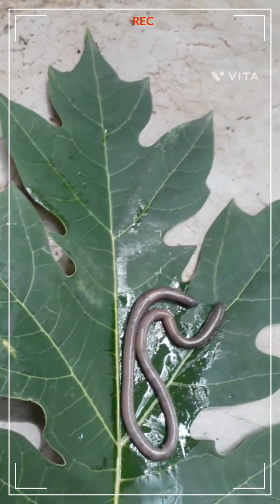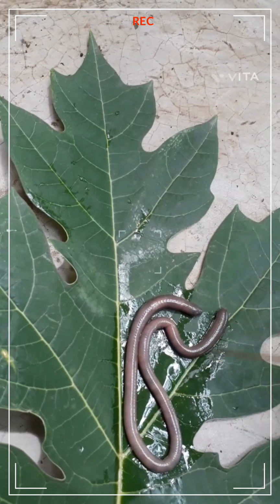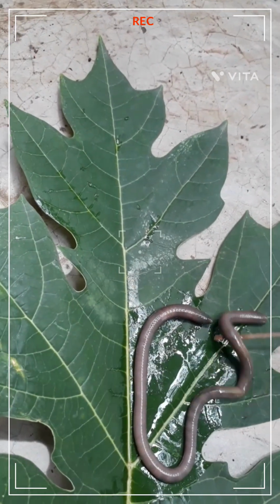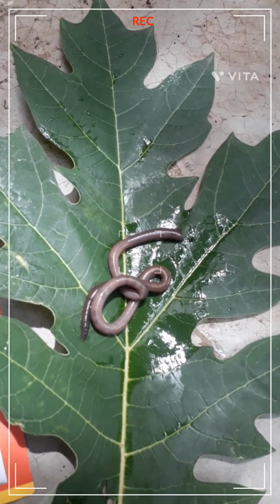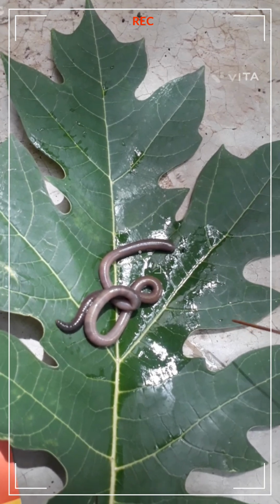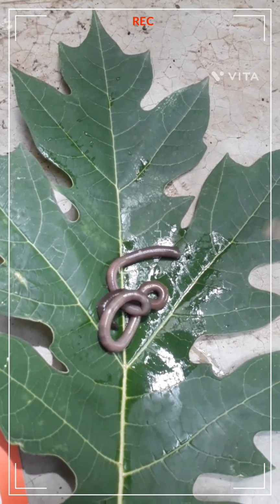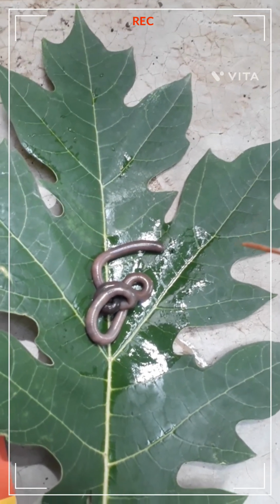This is the ventral side. It is distinguished by the presence of genital pores. Whatever I said by seeing the external features is called morphology. Up to this we saw the morphology of the earthworm, Pheretima posthuma.